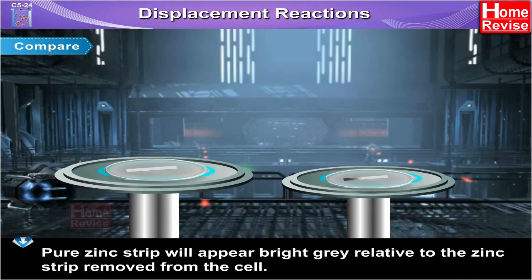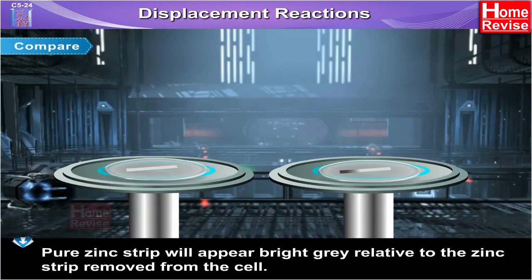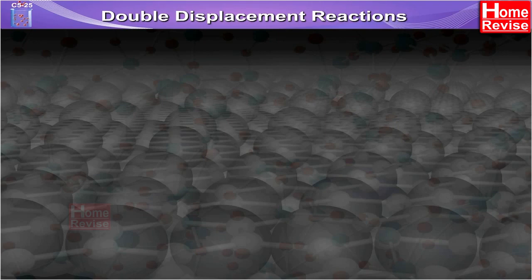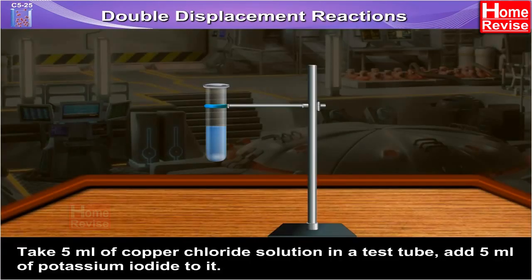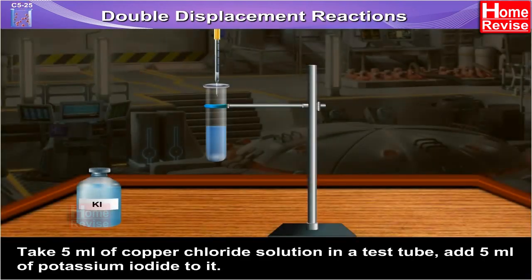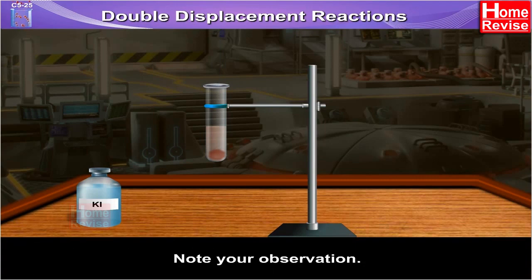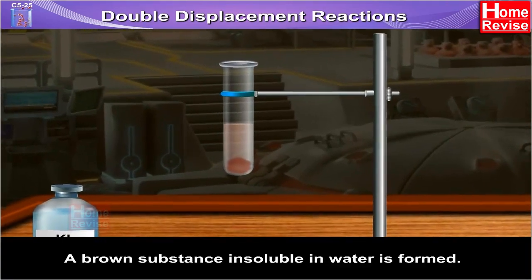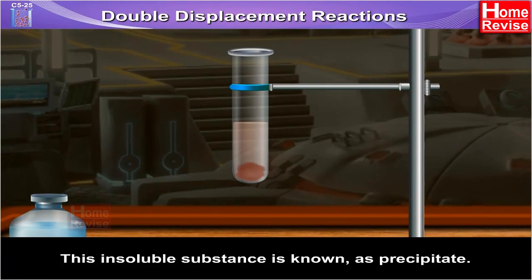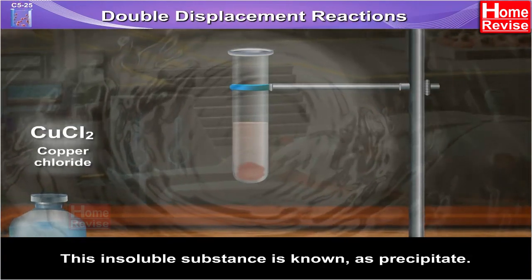Second, compare the color of the zinc strips. Pure zinc strip will appear bright grey relative to the zinc strip removed from the cell. Double displacement reactions: take five milliliters of copper chloride solution in a test tube and add five milliliters of potassium iodide to it. Note your observation.